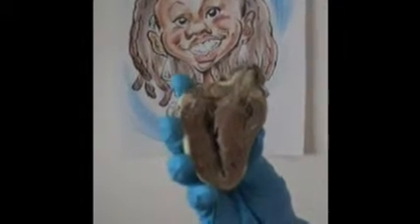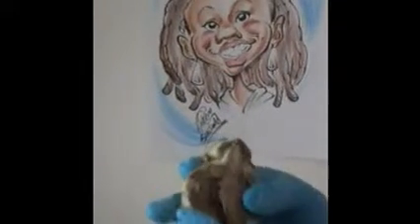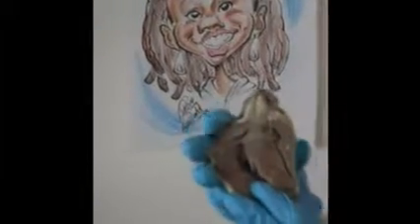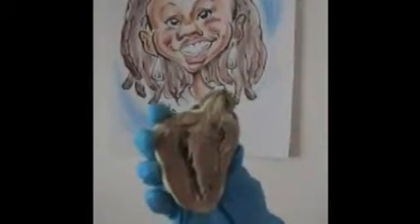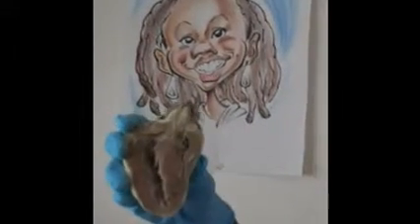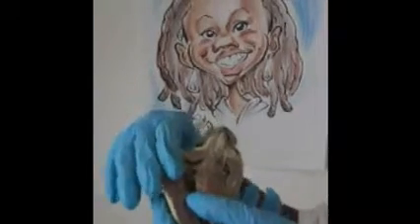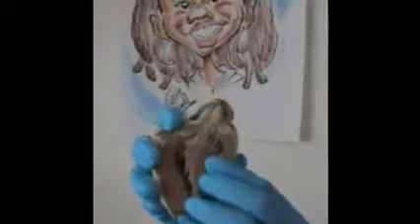Next we have the trabeculae carneae, which are going to be here on the inside of this right ventricle. Then we have the interventricular septum, which is going to be here. It kind of divides the left and the right sides of the heart. Okay. Then we have the bicuspid, which is the mitral valve. It's on the left side of the heart. It's going to be the left AV valve, which is there. And then we have the tricuspid, which is the right AV valve.